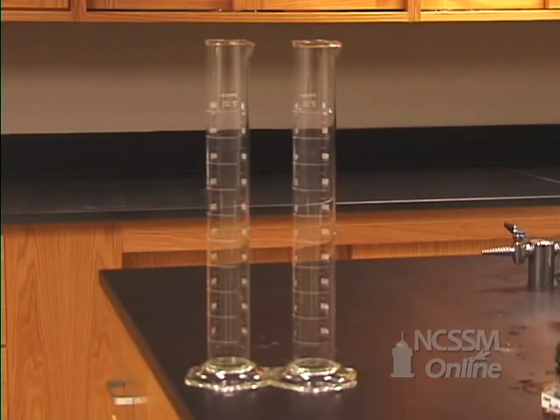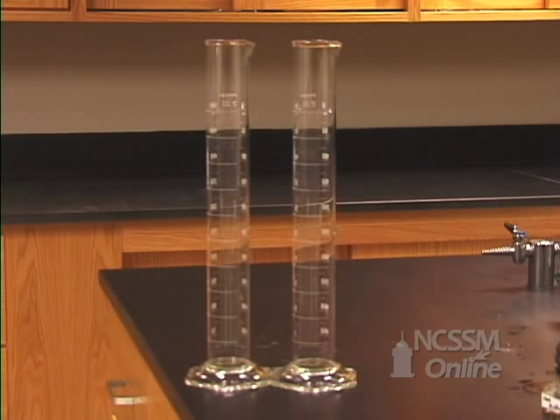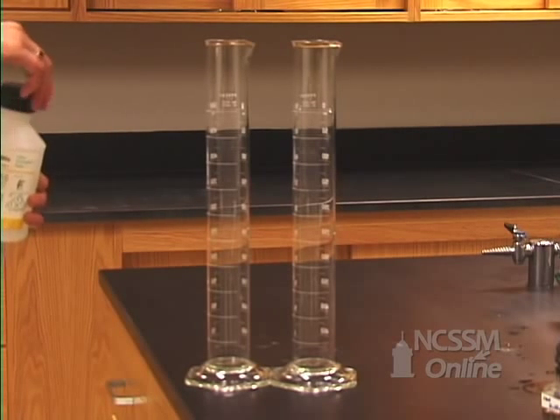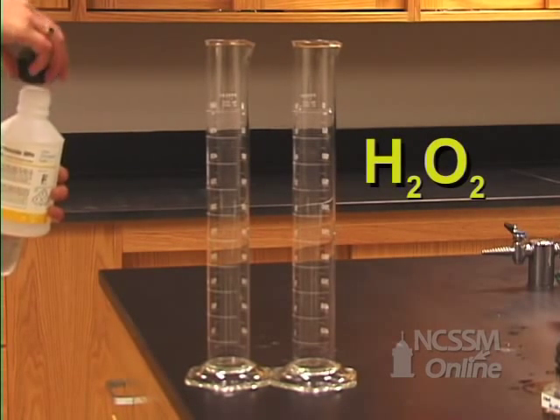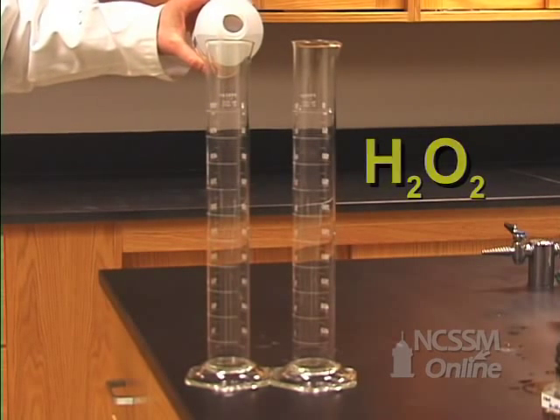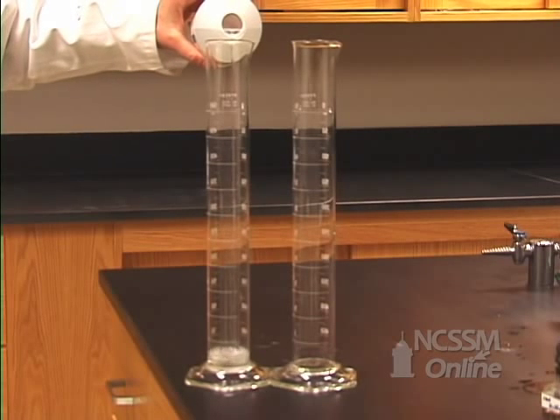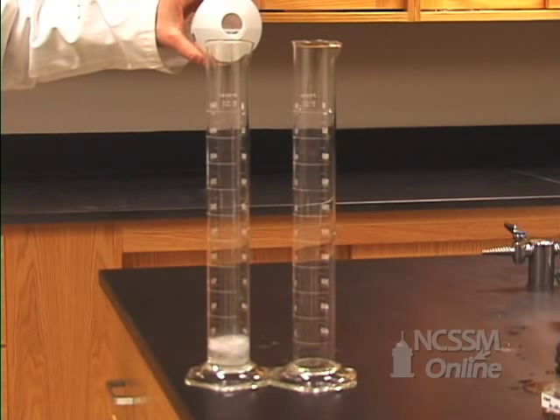What effect does a catalyst have on the rate of reaction? What I have here is hydrogen peroxide, H2O2, and I'm going to put about 50 milliliters in each one of these containers.